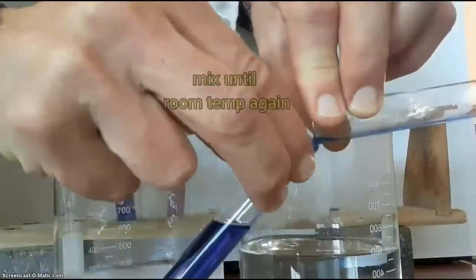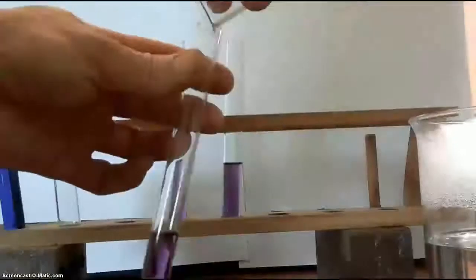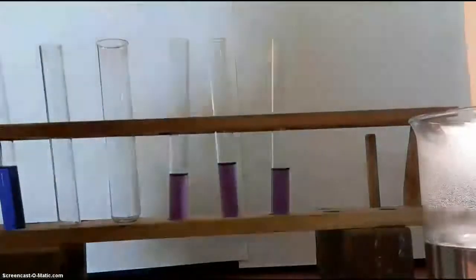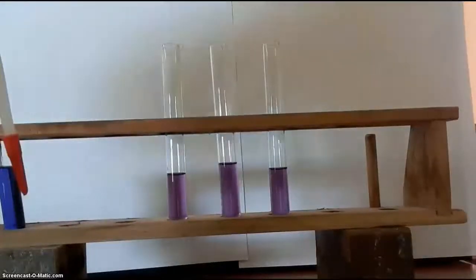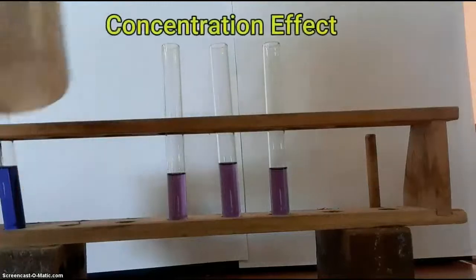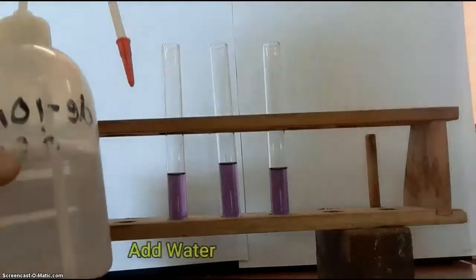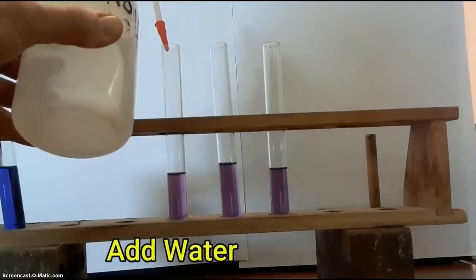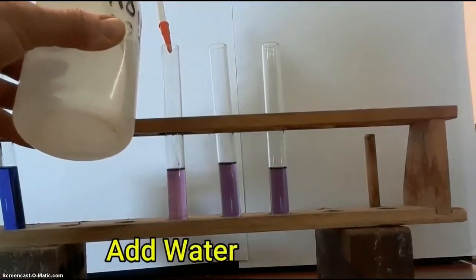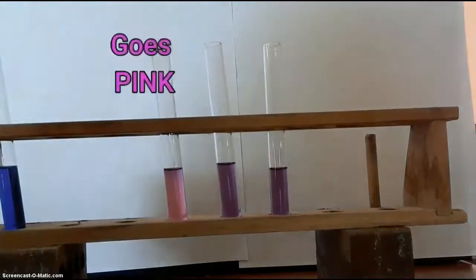Now we're going to mix them up again to get them all at the same temperature, and we start again. This time we're going to investigate the concentration effect. So we're going to add some water to the one on the left. And quite clearly you can see that it's gone pink.